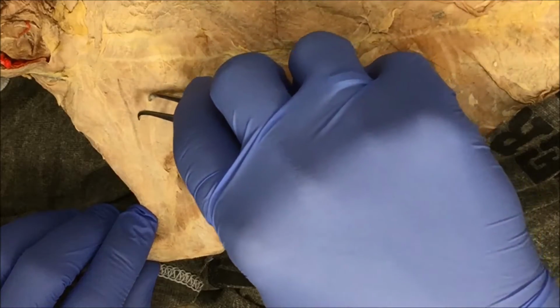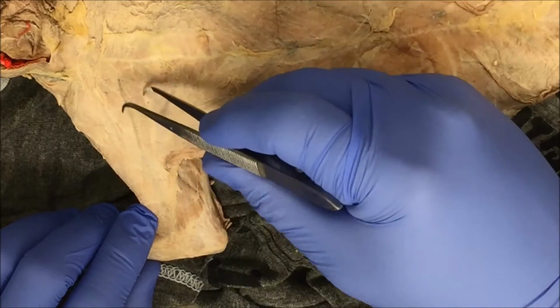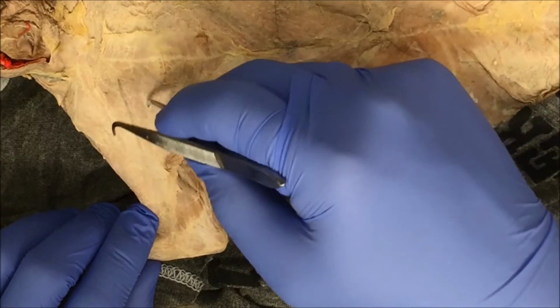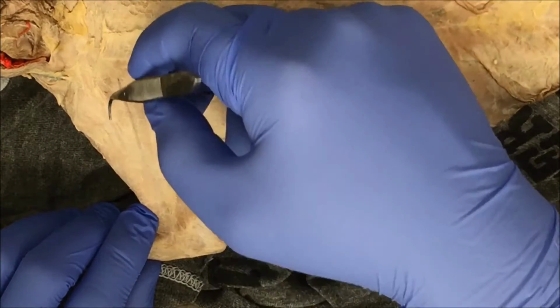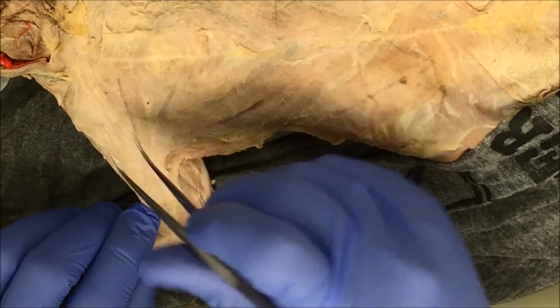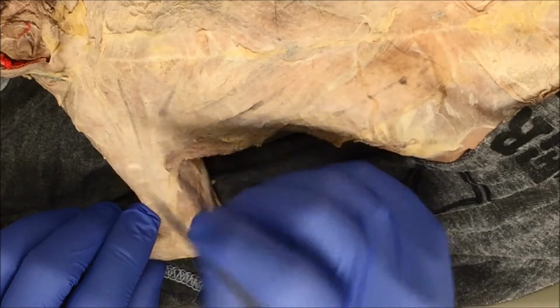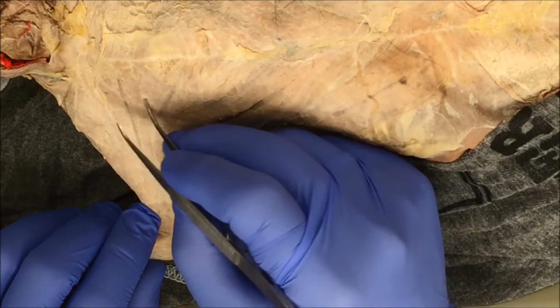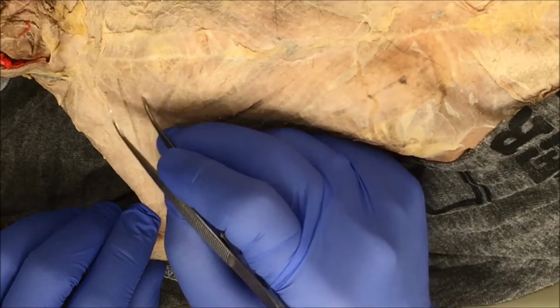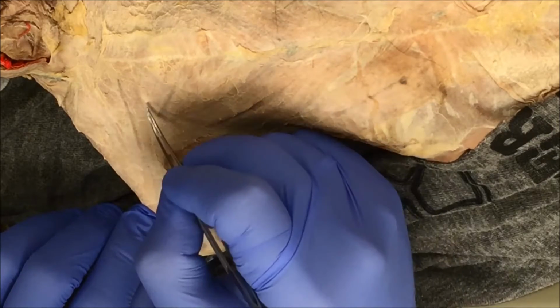Now, this is the time when you will really want to be careful when you use your forceps. You just want to carefully lift the connective tissue. You don't want to poke and scratch it like we've done with other dissections, because these muscles are so thin that you can shred them. So what we're going to do is create pockets, and this is where you're going to use your scissors and your scalpels almost extensively to separate these muscles.